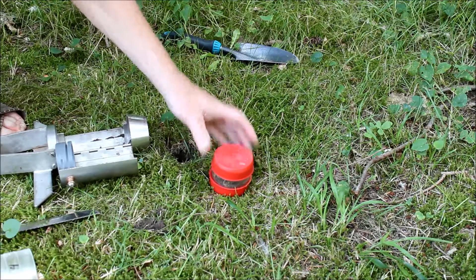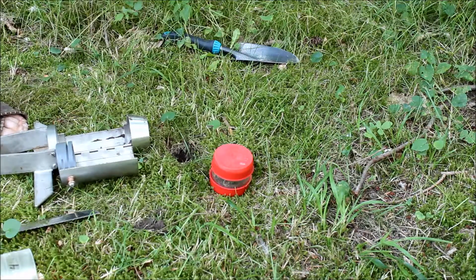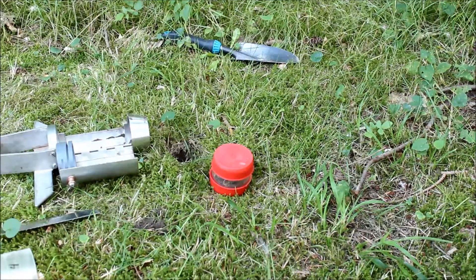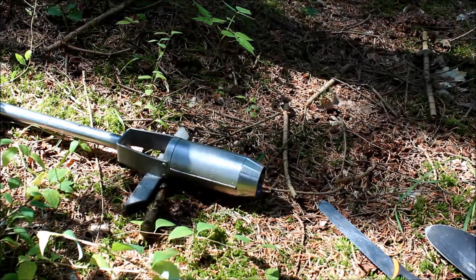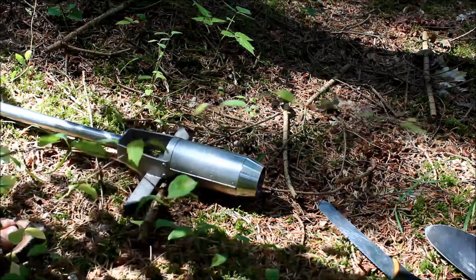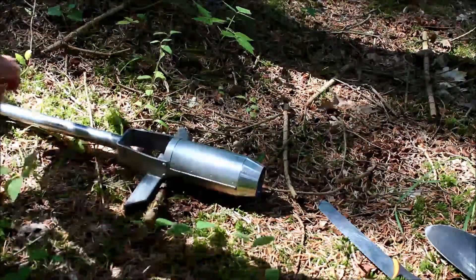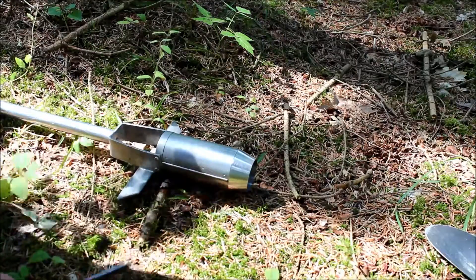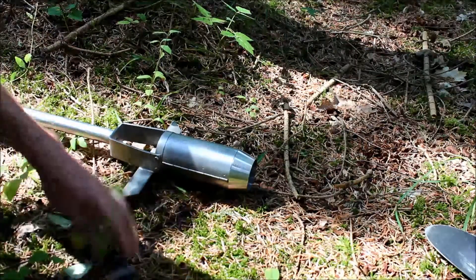We will do it like this. In soils where you have a thick layer of organic matter and plants — in this case it's needles and moss.